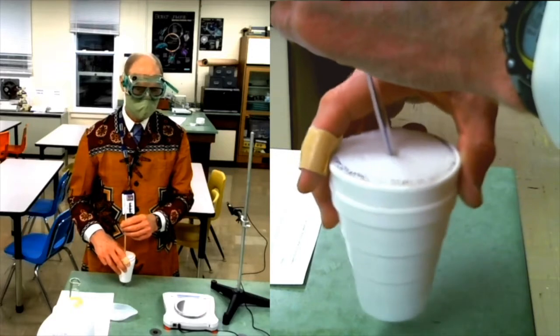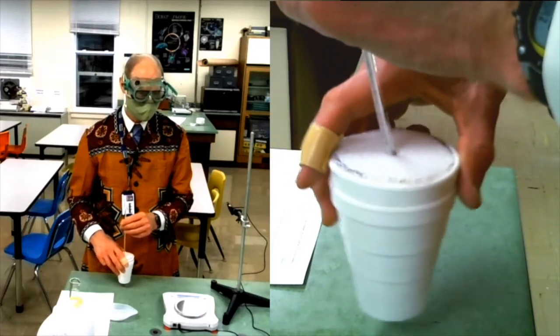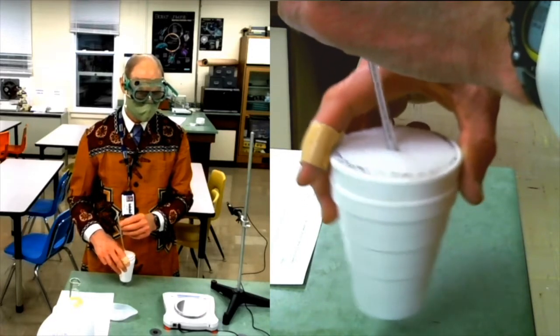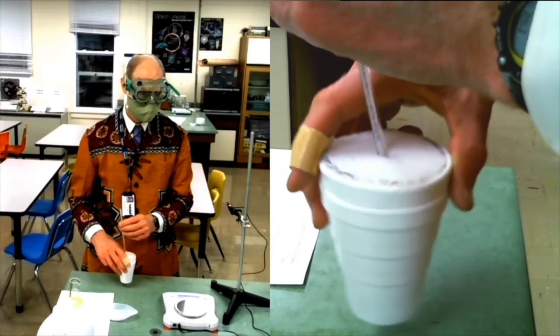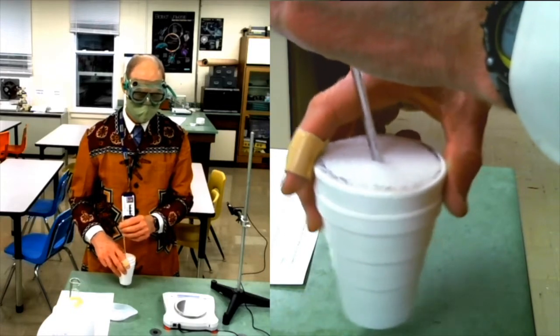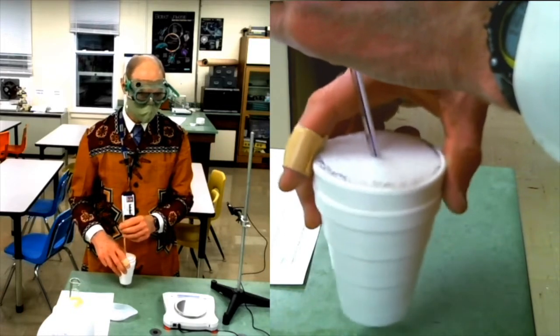I can hear the solid tapping against the thermometer glass. So, I know it's not all dissolved yet.